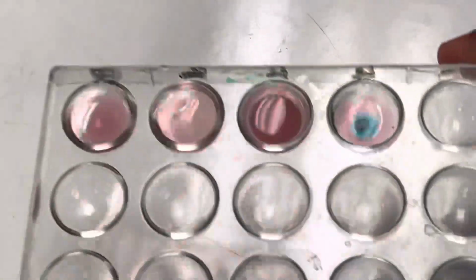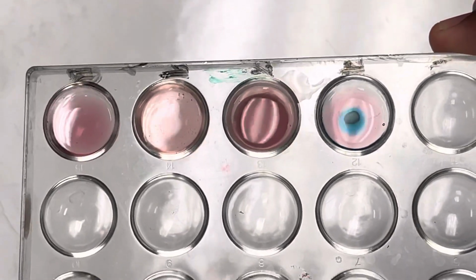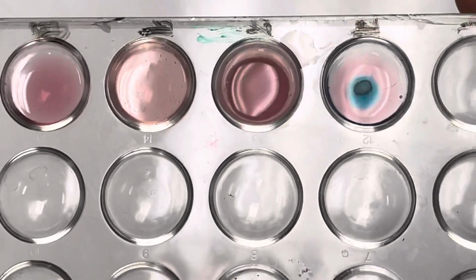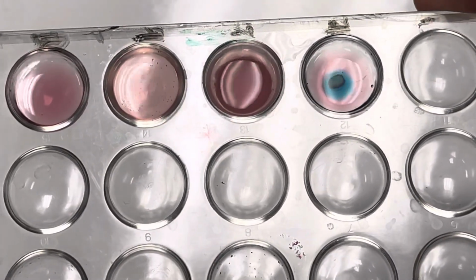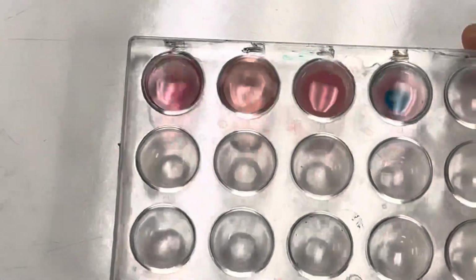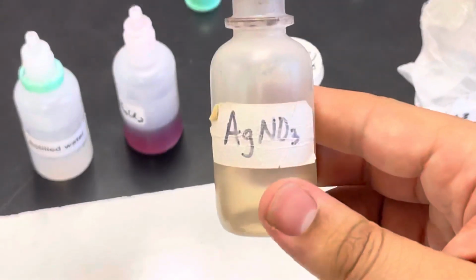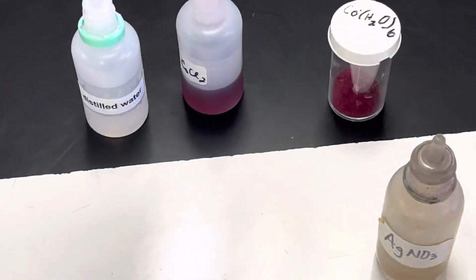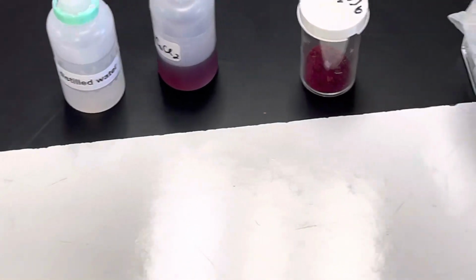I wonder if I can get a better view. Maybe you can tell. Because that third one from the left, right, that one that I was just talking about, you can't really see light passing through it. The other ones you can. Anyway, the idea is that it's cloudy now. You might think about, why is that cloudy? Did another reaction happen, maybe? And there we go, that's that.